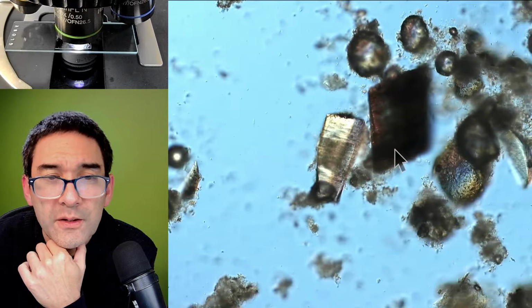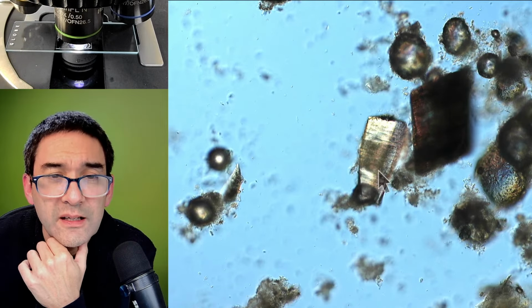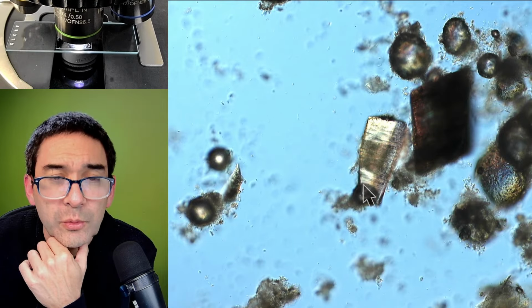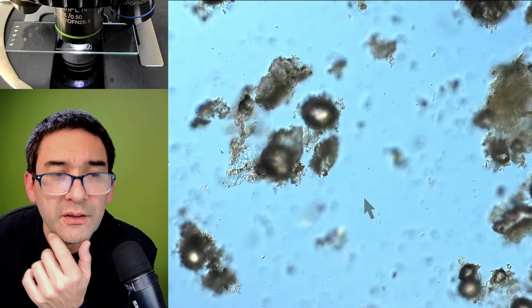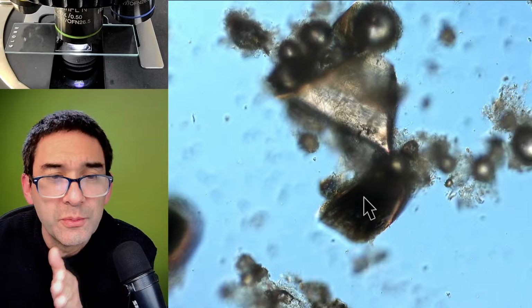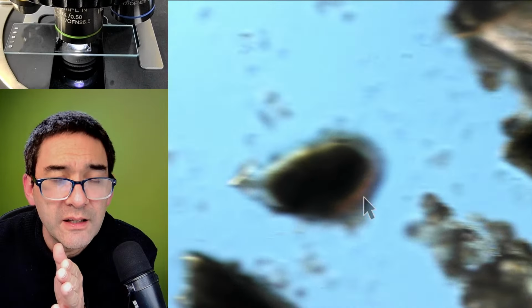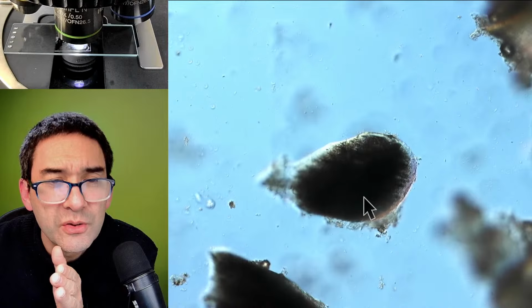Yeah, because you're talking about an angle, this one definitely is cut at an angle. You see over here, it's a little bit wider than over here. So the next interesting thing would be to look at the cut edge to see if there's a difference between a fresh razor blade and an old one. I don't know. Is this also one of those here?